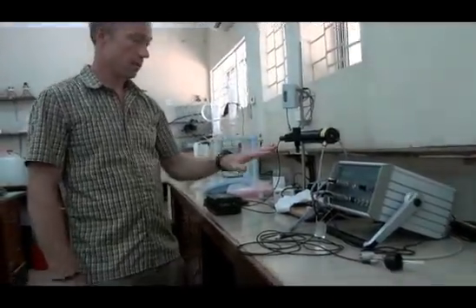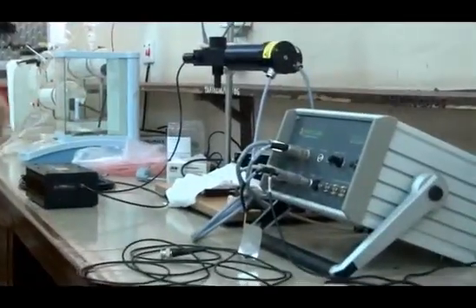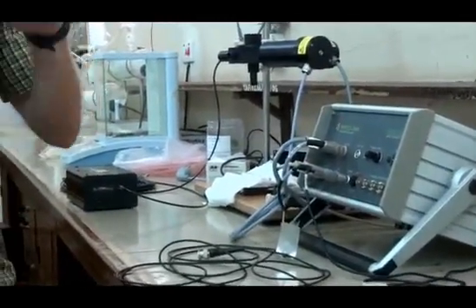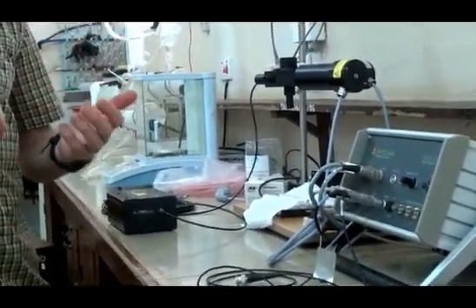This instrument makes it possible to do sensitive measurements and understand how the lake at various depths has different photosynthetic activity.